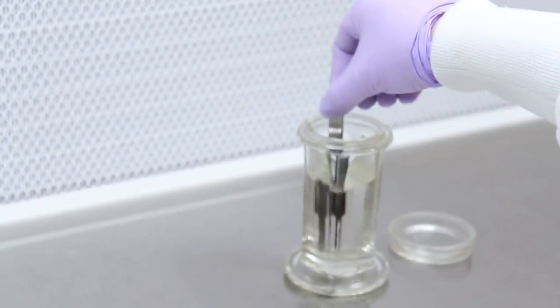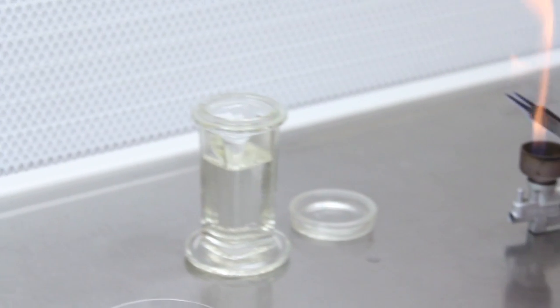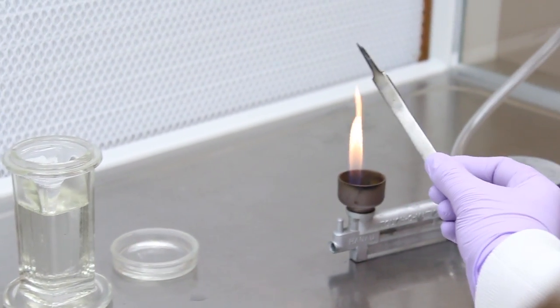Wash both sides of the tweezers in ethanol and sterilize them in the Bunsen burner flame. The ethanol will kill some contaminants, but the flame sterilization is the most important part.